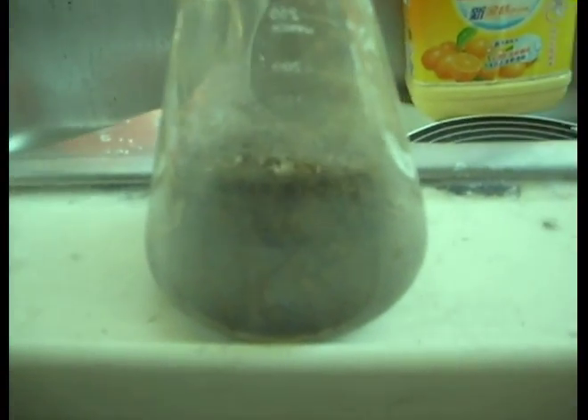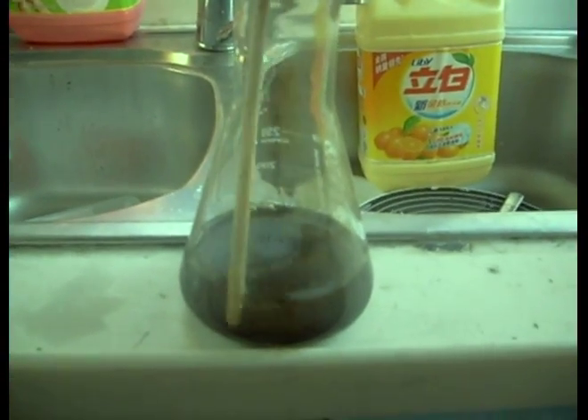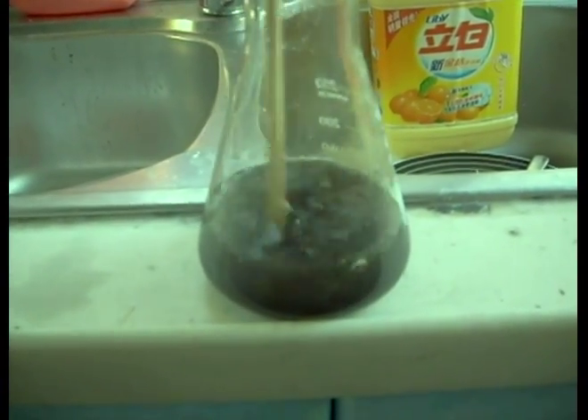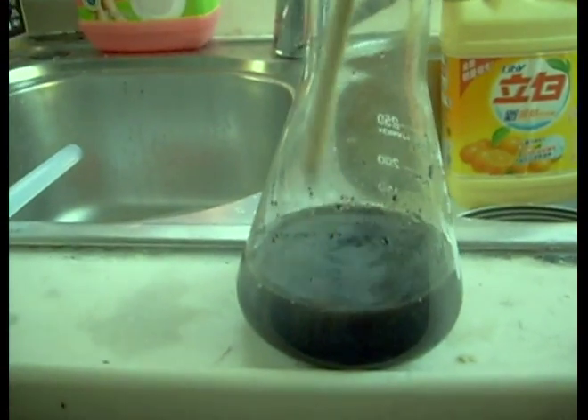Here's what we got from the rust and vinegar burn-off. There's a little bit of a red tinge to it, but it's mostly black. Now that doesn't mean anything, so let's try dissolving it and see what we get. It's rather burnt up so it's going to take some work. It's not dissolving very well — this is taking a lot of work, but I've scratched it up pretty good. I think I got the particles broken up pretty good.